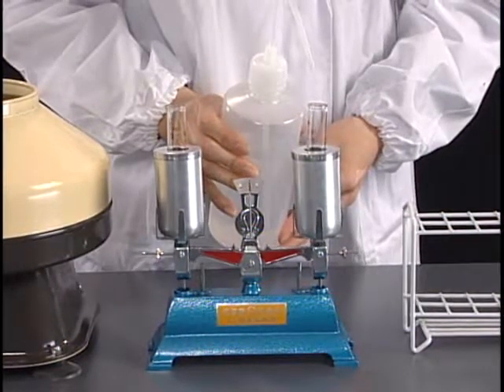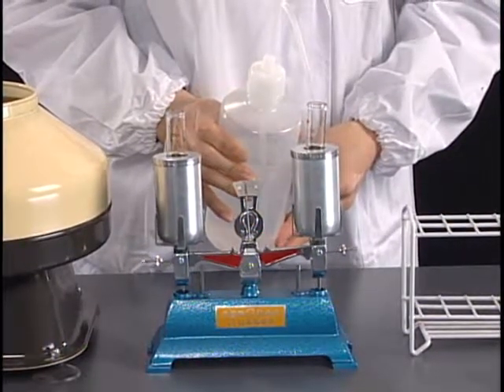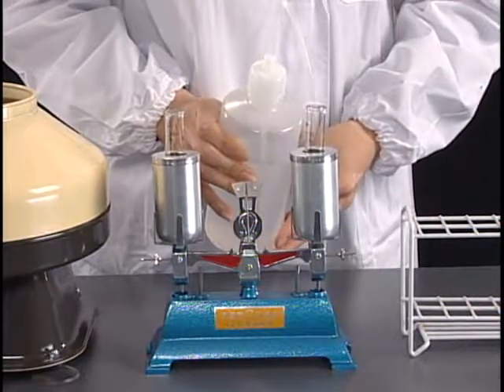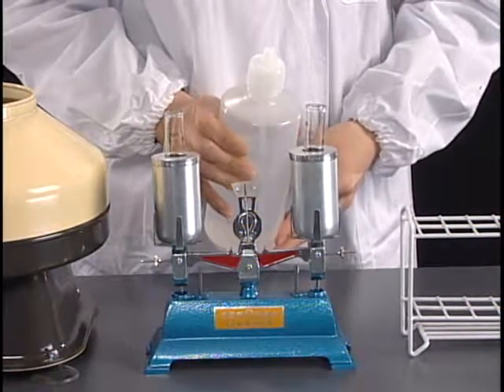Add distilled water little by little into the balance tube until its weight becomes equal to that of the sample tube.